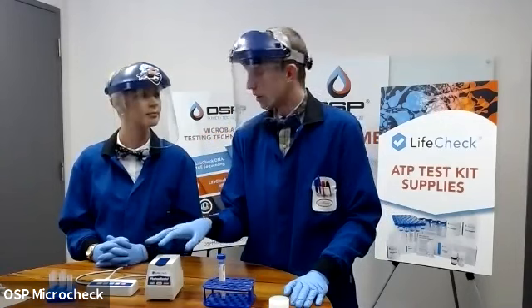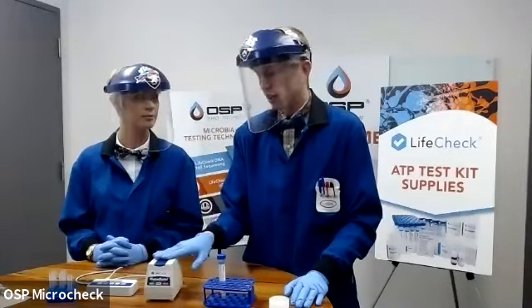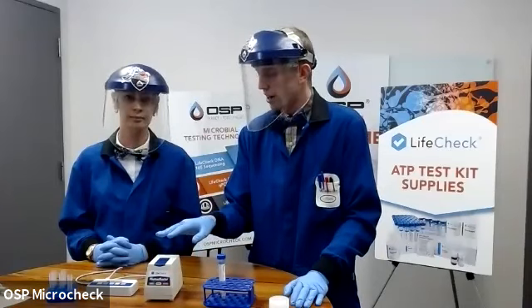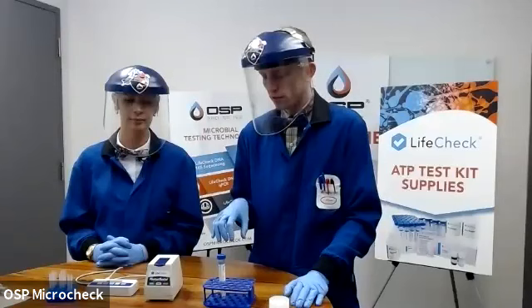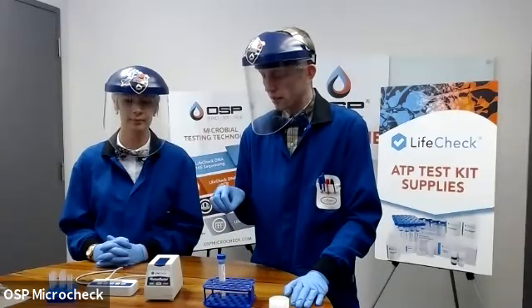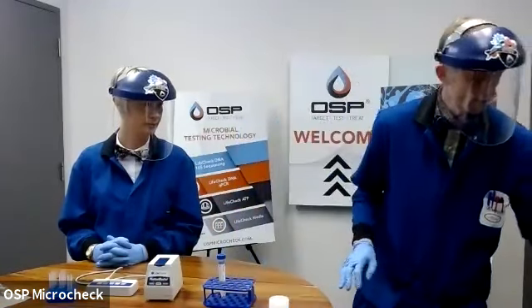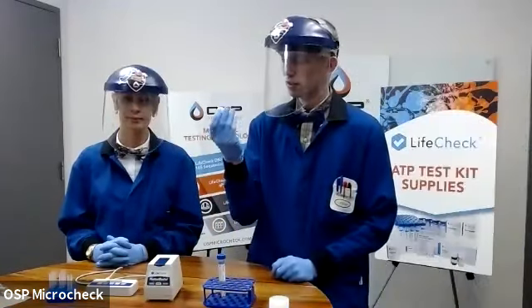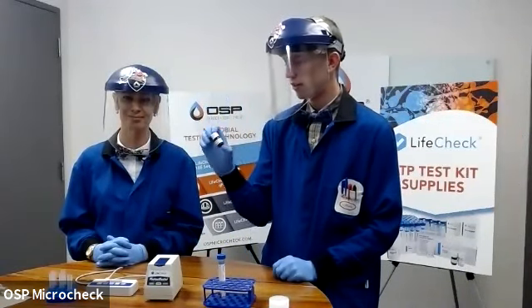So that's a good point here. The data that comes from this is relative light units, or RLUs. So the reaction that we're going to take advantage of today in order to determine how much ATP is in our sample unknown is a luciferase reaction. So what I mean by that is that there is an enzyme or living component, that's our reagent Z. This is a luciferase enzyme.